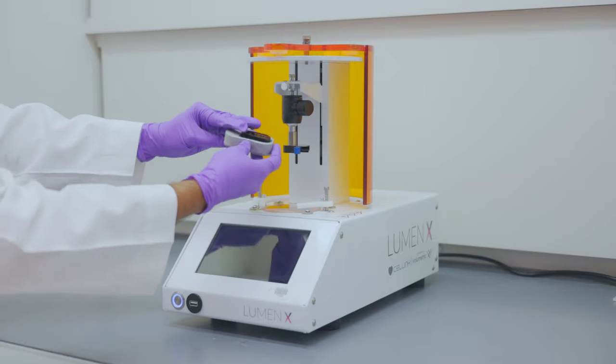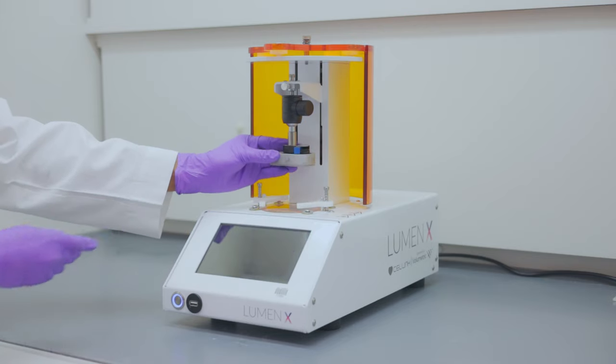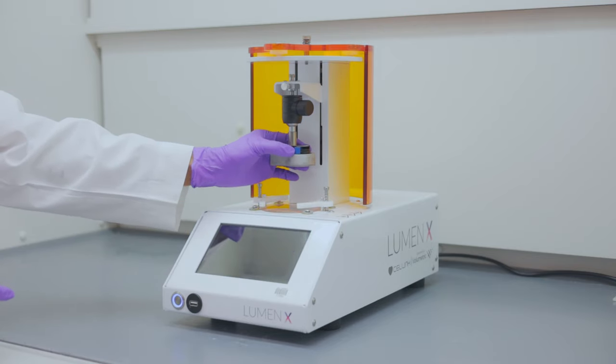To reinstall the build platform, slide the build platform and turn the blue knob until it clicks in place.